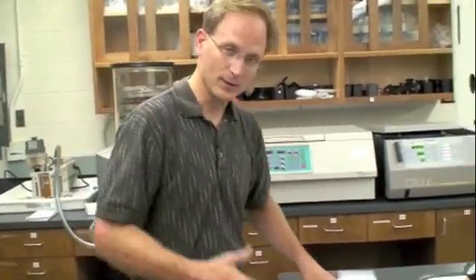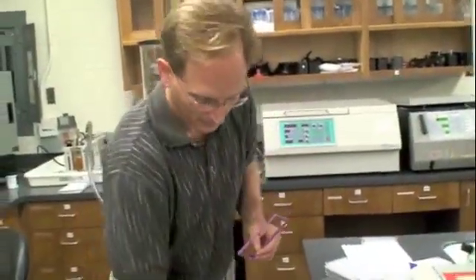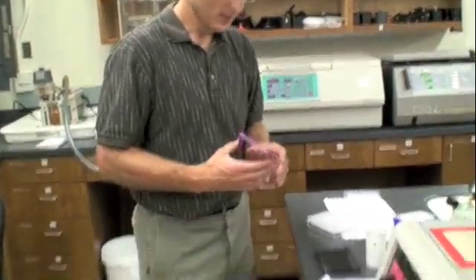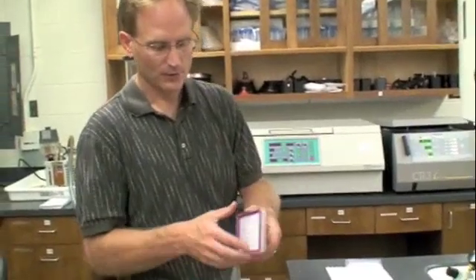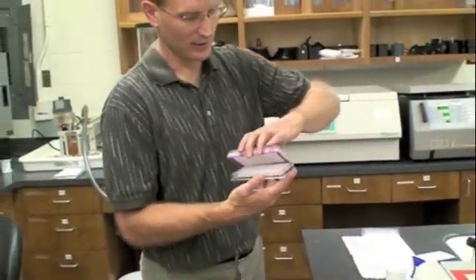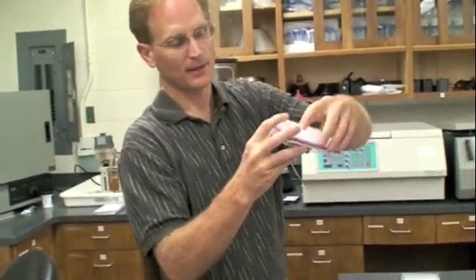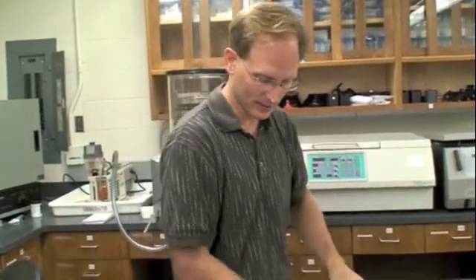Now you'll understand more of this as we go through. It'll probably be more clear as I use the examples. Now there are four of these rings, and they're in this drawer here. They do not leave this drawer when you're done using them. There are only four for the entire lab. These rings are actually fasteners that hook together the filter plate to the catch plate. That's just so they don't come apart while it's spinning. It holds them on fairly tightly.